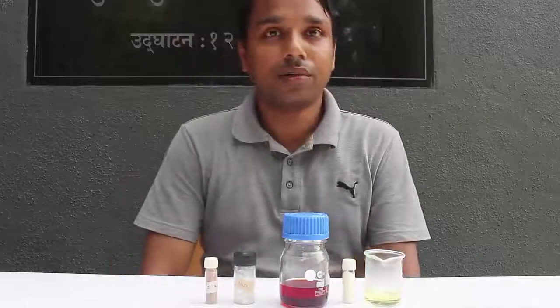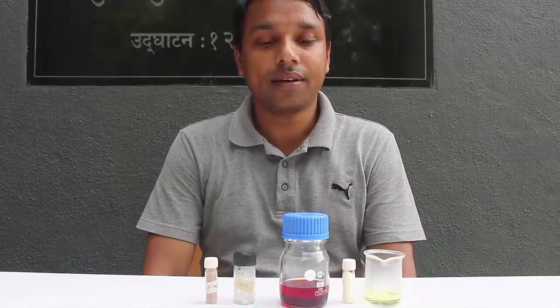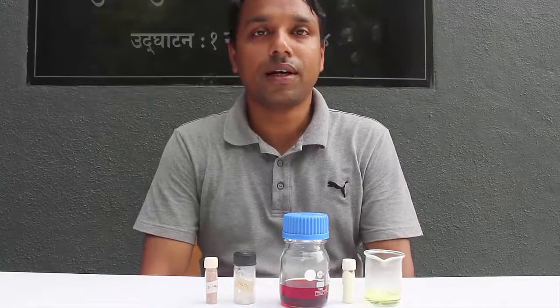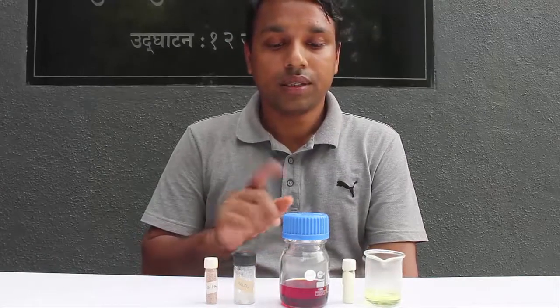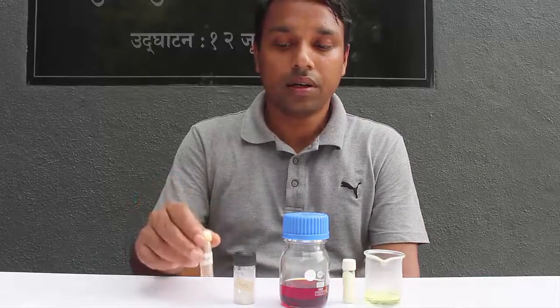Friends, in today's chemistry experiment we will prepare a compound, a very colorful dye. Now dyes are important because they give us colorful clothes and fabrics.